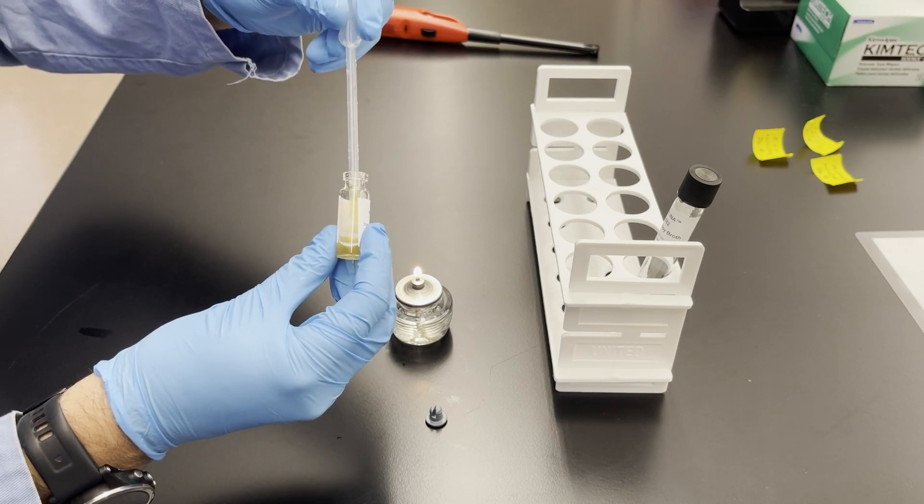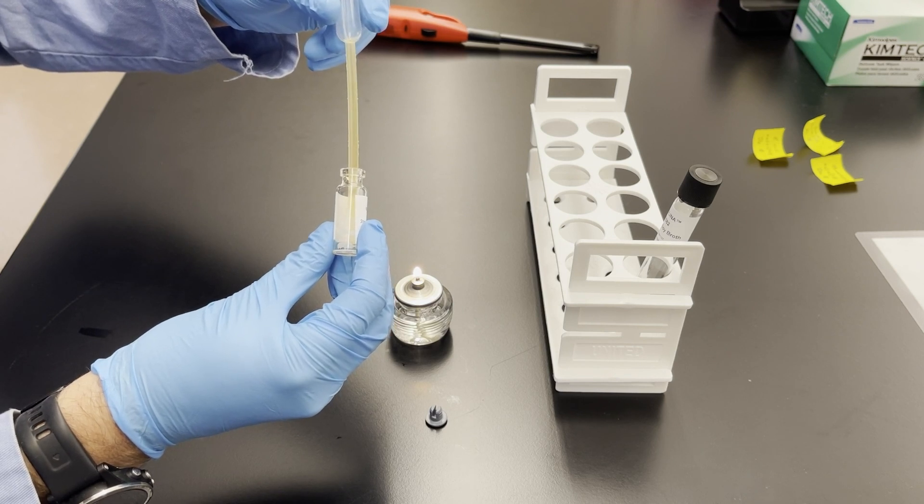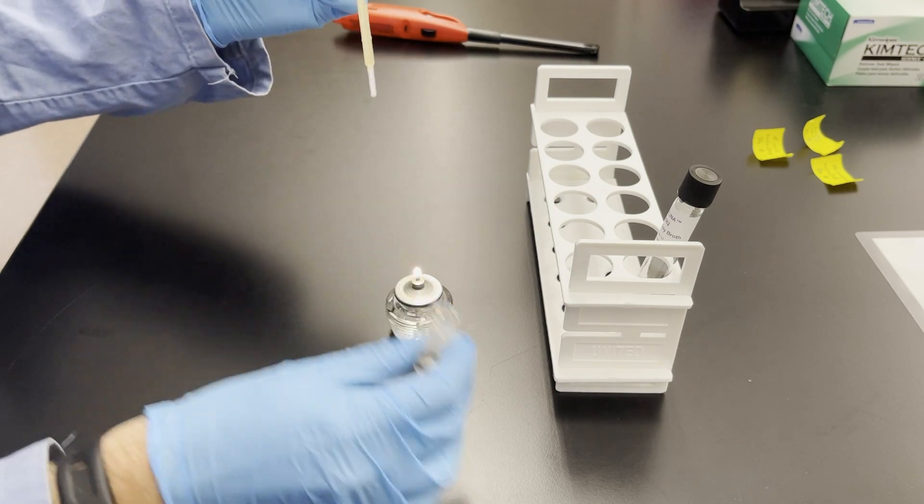And so then finally I'm going to draw up all of that liquid with all the bacteria. So you want to get as much as you can out but again trying not to get a lot of air bubbles in there.